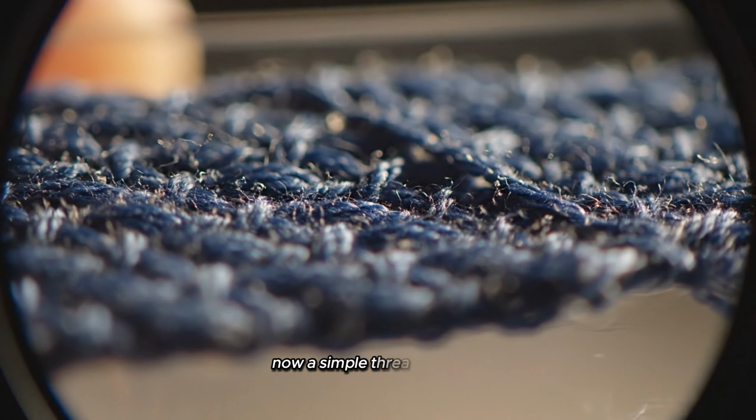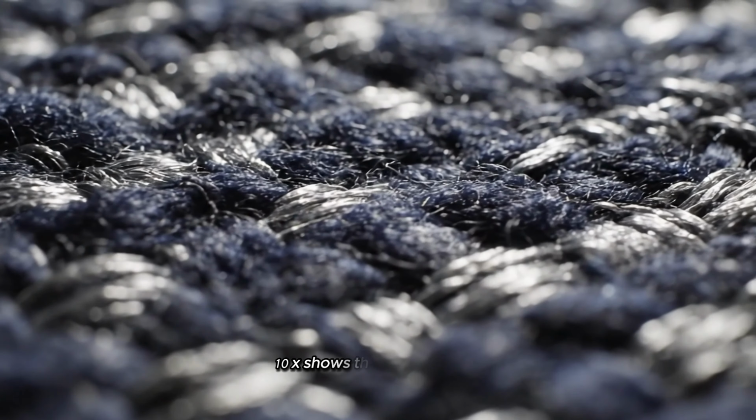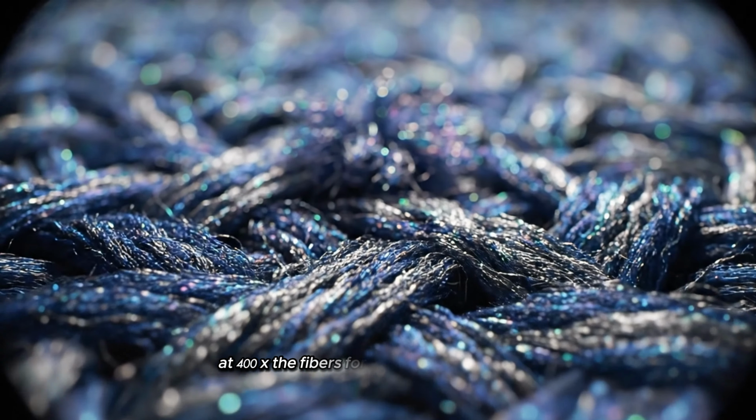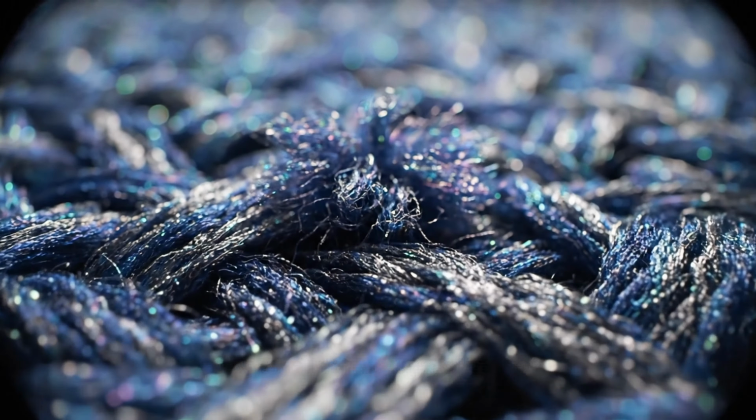Now, a simple thread of fabric. 10x shows the twisted fibers. 100x reveals the microfibers interwoven like a tiny bridge. At 400x, the fibers form a complex landscape, almost like a miniature city of threads.